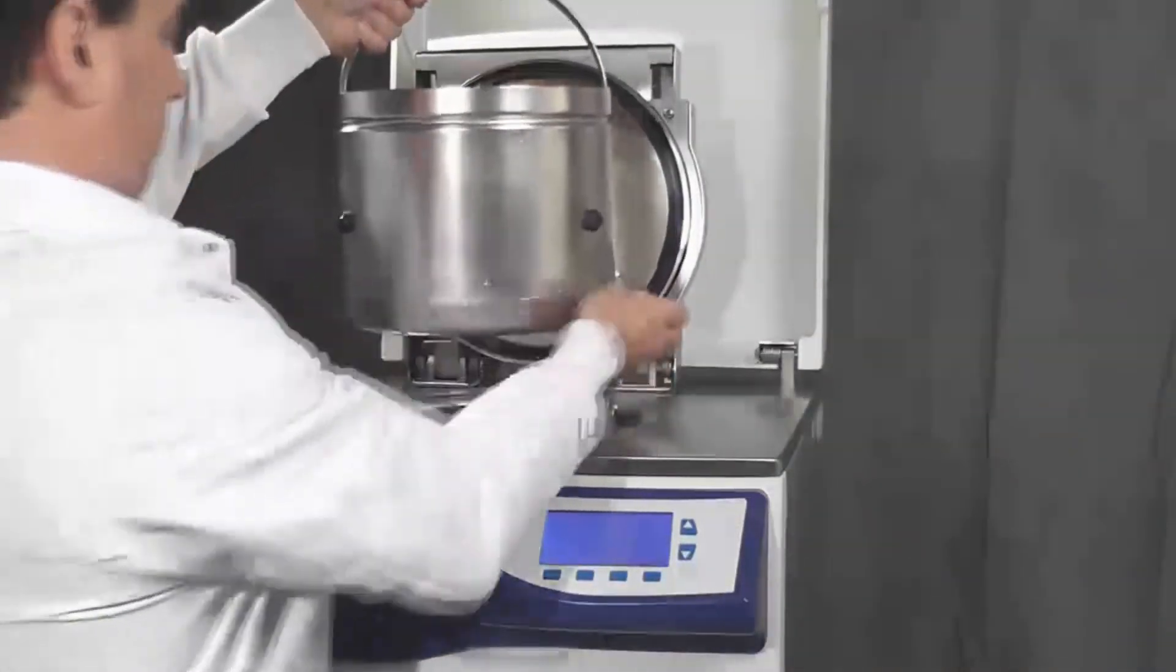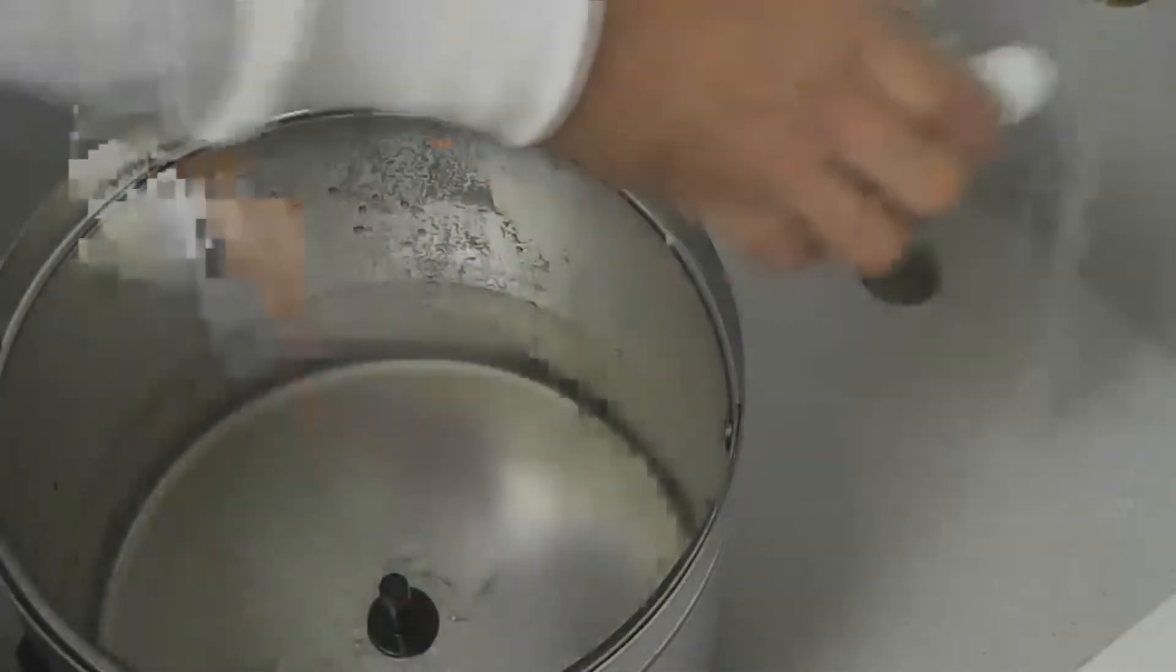After dispensing, remove the sterilization vessel. The vessel and magnetic stirrer can be rinsed in the sink prior to your next media batch.